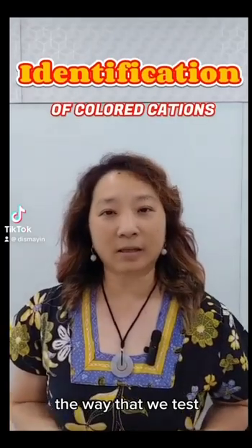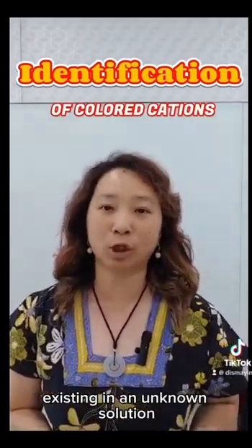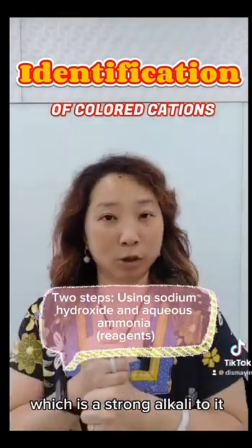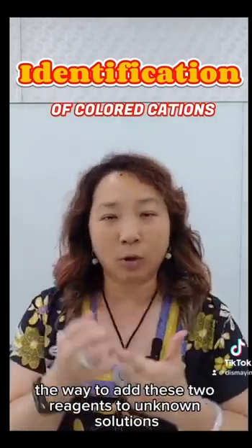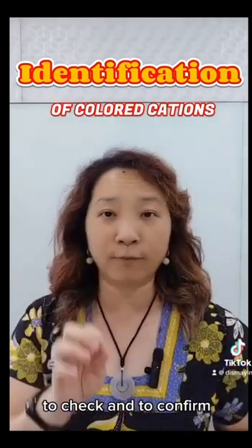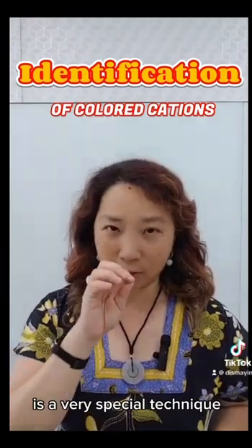The way that we test for the different kinds of possible cations existing in an unknown solution is basically to add either one, sodium hydroxide, which is a strong alkali, or two, aqueous ammonia. The way to add these two reagents to unknown solutions to check and confirm the kind of cations existing in those unknown solutions is a very special technique.